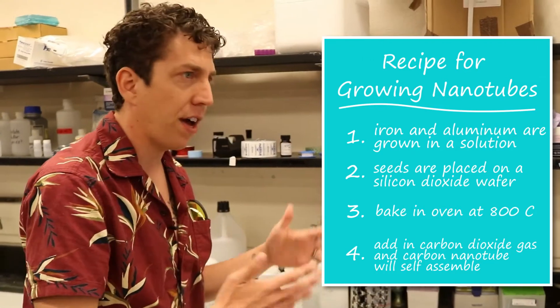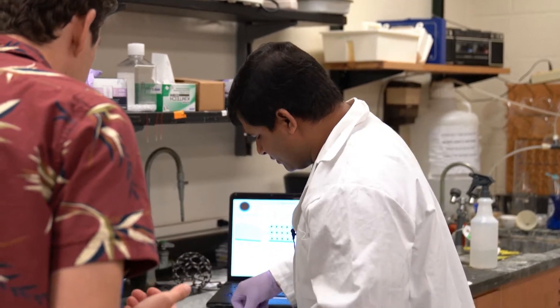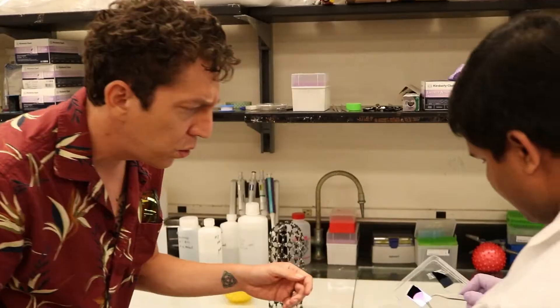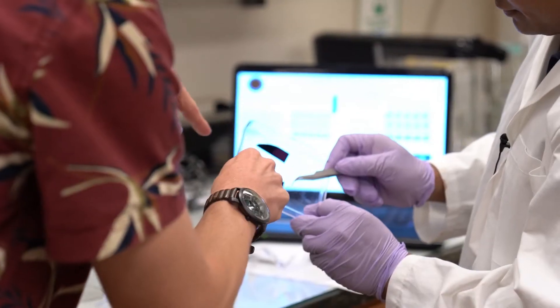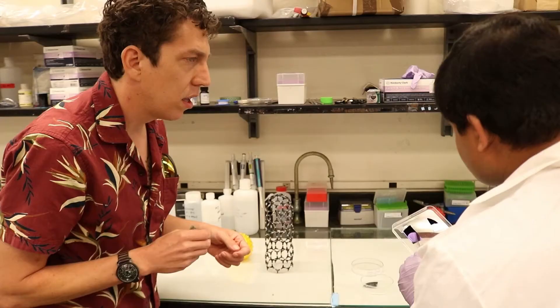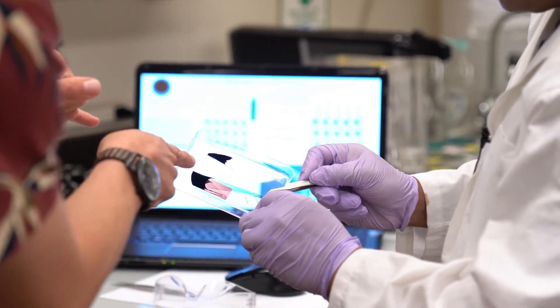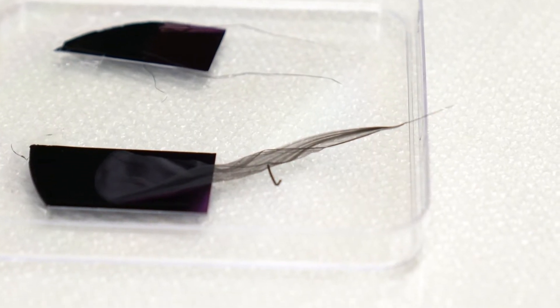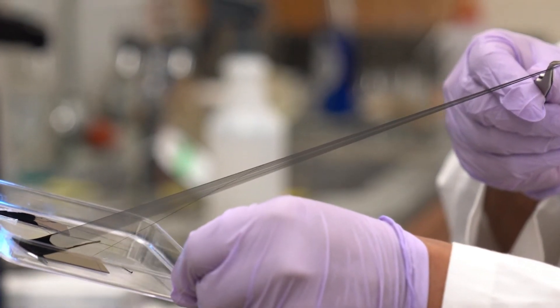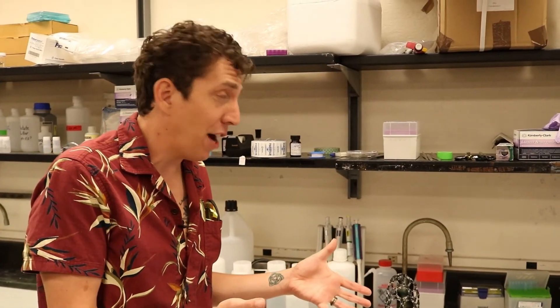After growing the tubes on the substrate, you can see the substrate is covered with lots of nanotubes — it looks very black. Those are actually spinnable: they attach to one another, so we can make a fiber from them. You can stretch it and see lots of tubes coming together, and we can look at that fiber.